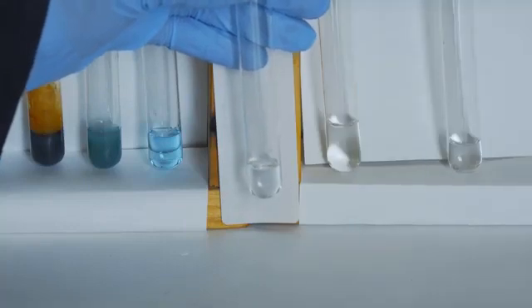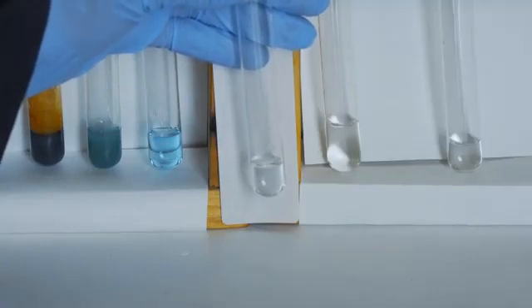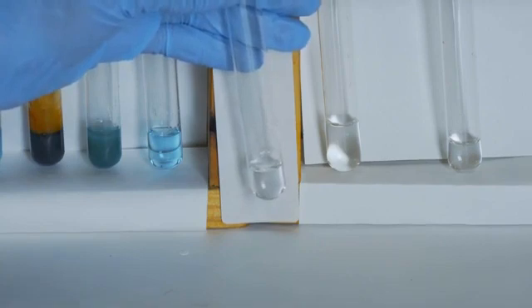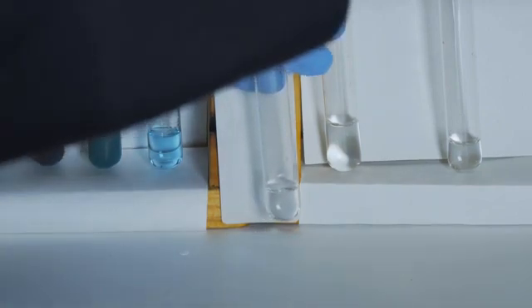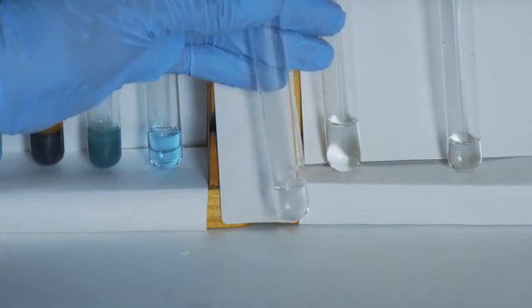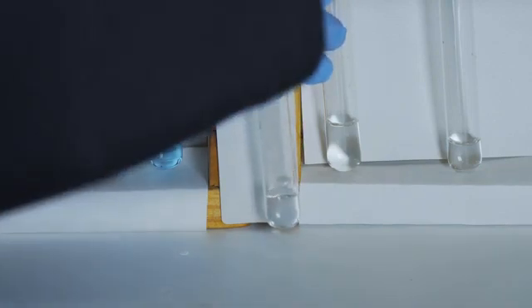To our unknown solution H, which is clear in color, we add in 3 drops of the ammonium chloride and 5 drops of the ammonium hydroxide.